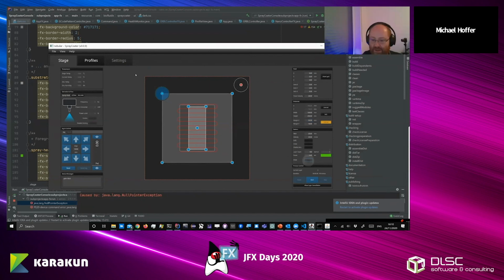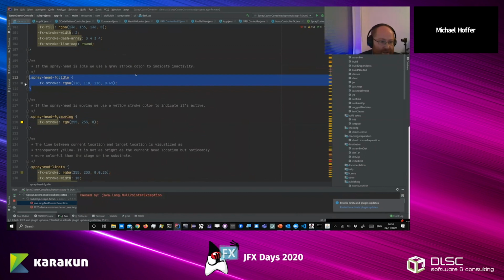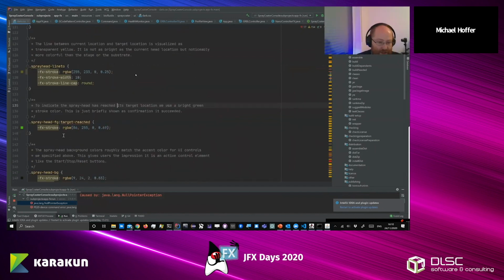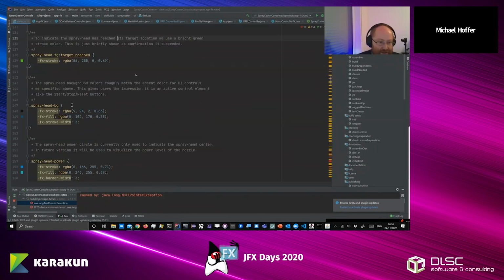Then for the spray head, we have some different circles actually. So the spray head foreground here is green in this case, so a green stroke. And for idling, we just use a rather inactive looking gray, etc. For moving, we have yellow, and for the line too. So when the head actually moves while you're dragging it, we have this transparent yellow. And then we have animation colors for when you reach the target, and we have some styling for the head itself.